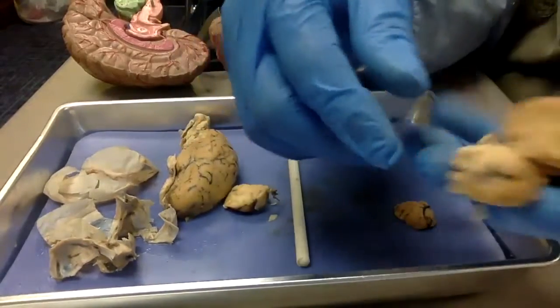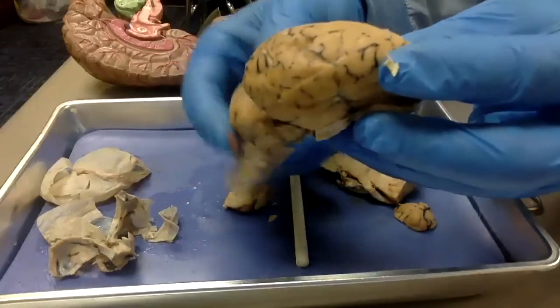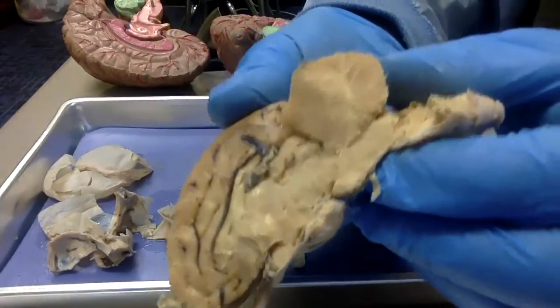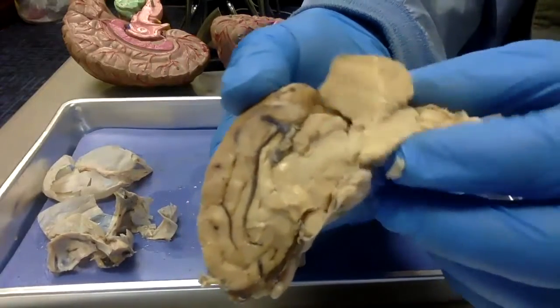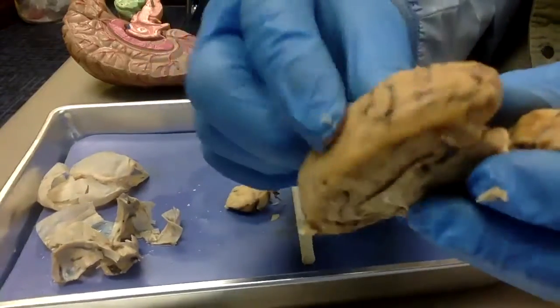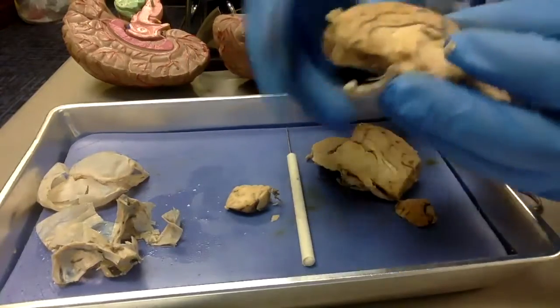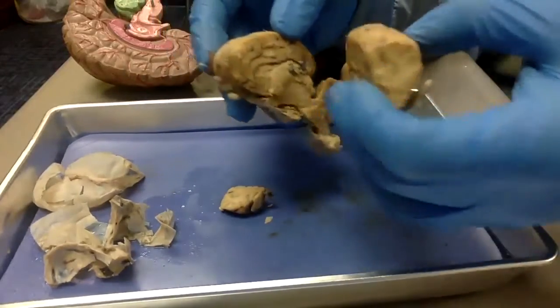Let's get to this whole brain so you have a better idea now. We have the cerebellum. The cerebrum is on the top, the cerebellum is in the back. When we look at it, the cerebellum also has much of the same. It looks like white branches on the inside, but it's only communicating with itself and the brainstem. Those white branches do not reach out to the cerebrum. So independent thought right here. Over here, we have some more white matter. The corpus callosum is a type of white matter that shares information with this side of the brain.